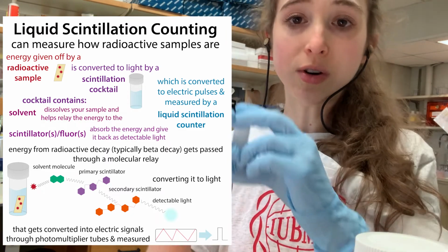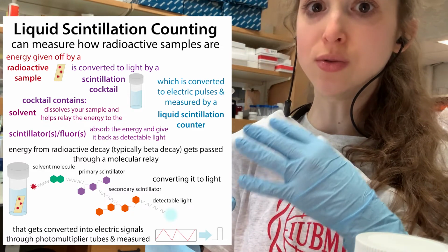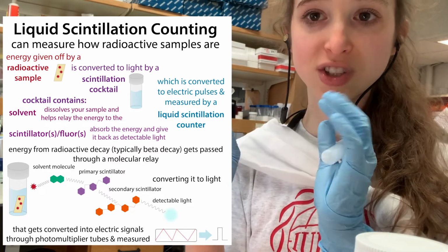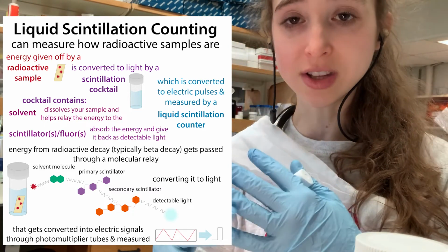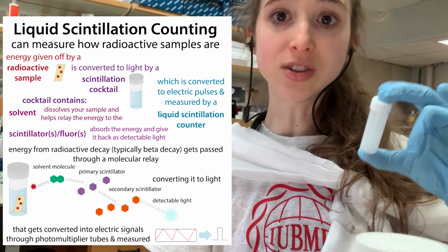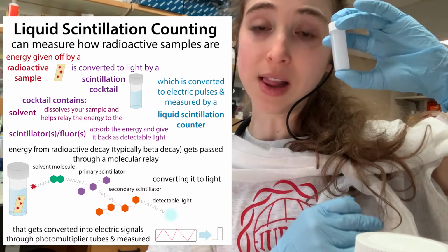And then we're going to stick this into a machine, and this machine is going to take that light and convert it, using photomultiplier tubes, into this electrical pulse, and then the computer can measure this and calculate how much radioactivity was in your sample. And so you can then get ideas about what's going on at the molecular level.